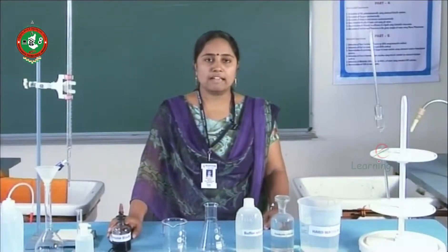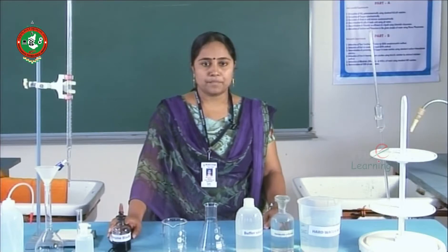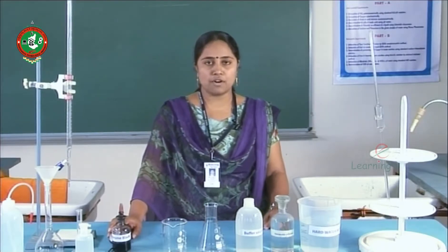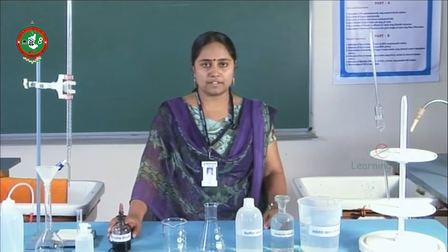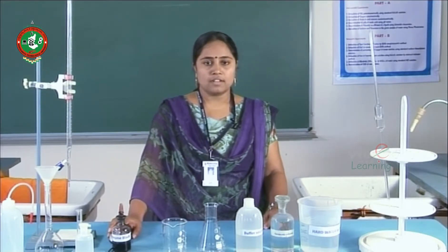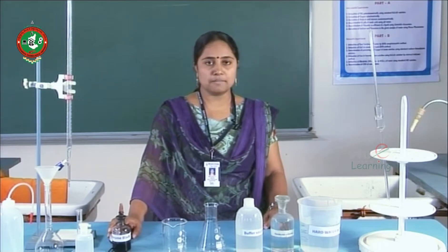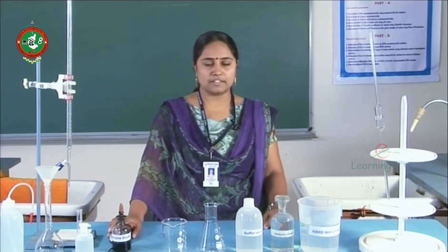Estimation of sodium and potassium in the given sample of water using flame photometer. The volumetric experiments are: estimation of total hardness of water by EDTA complexometric method, and estimation of calcium oxide in cement by rapid EDTA method.